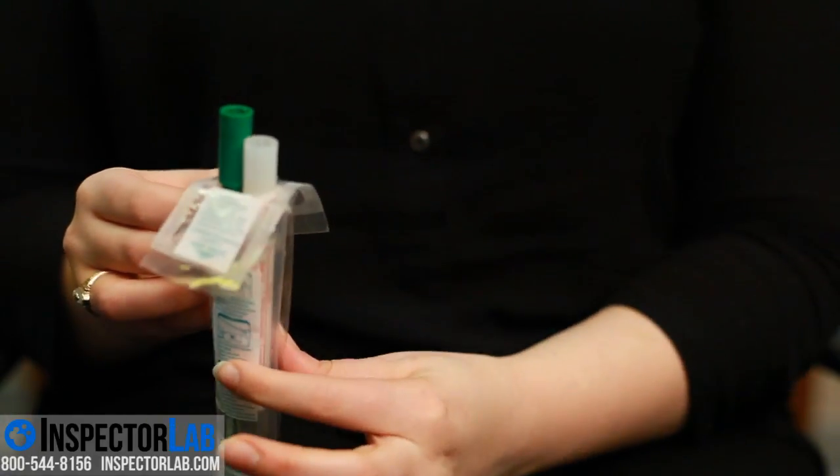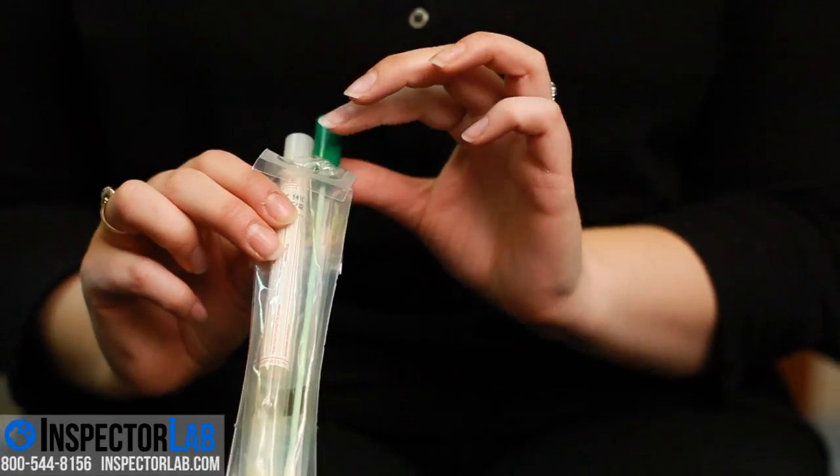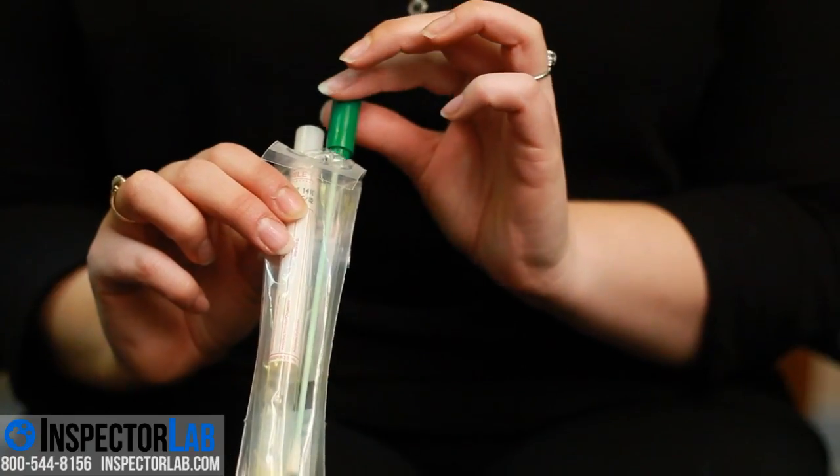Remember, some mold types like Aspergillus, Penicillium, and Wallemia can grow and spread when available moisture is extremely limited.